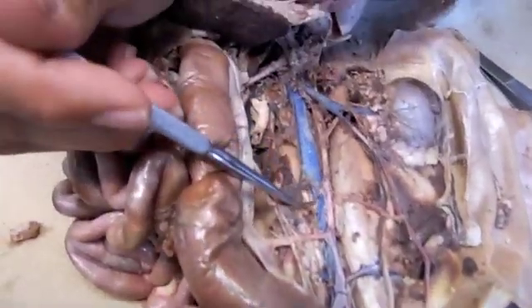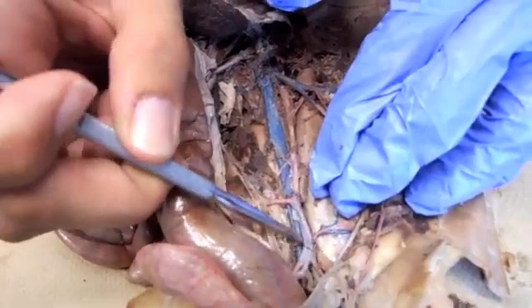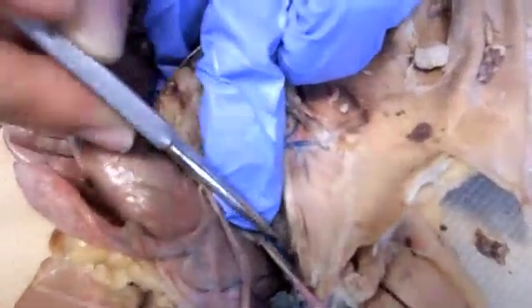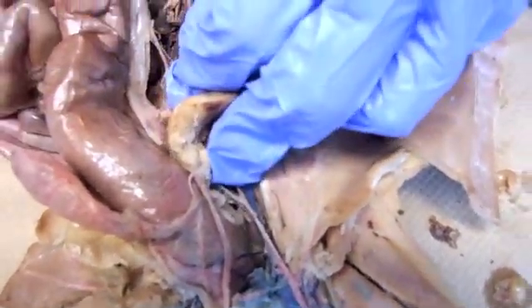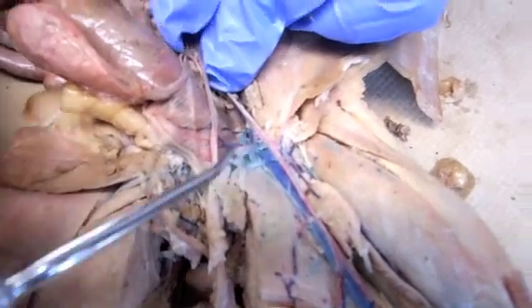For your veins, you have the inferior vena cava going all the way down until you hit your common iliac. You have your external iliac and your internal iliac right there going into the pelvis. After the deep femoral you have your femoral, which turns into the great saphenous. Your popliteal should be back here and your tibialis anterior should be over here.